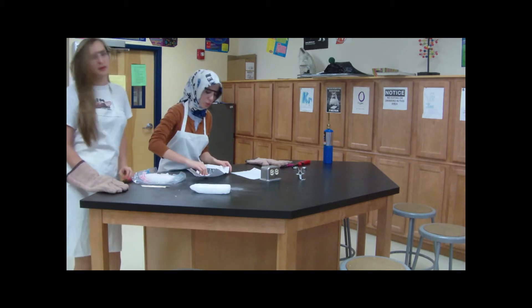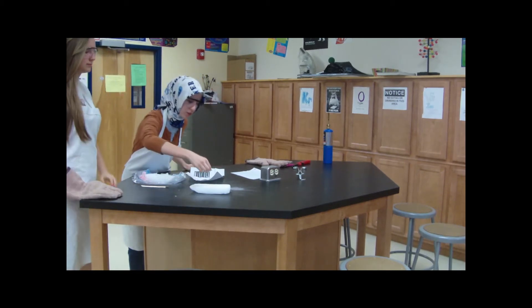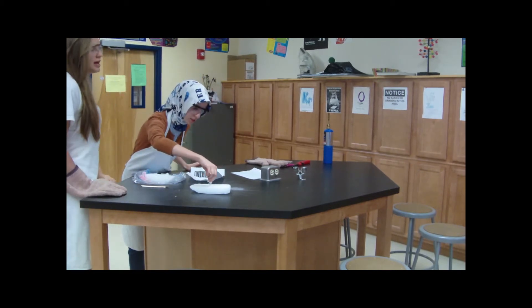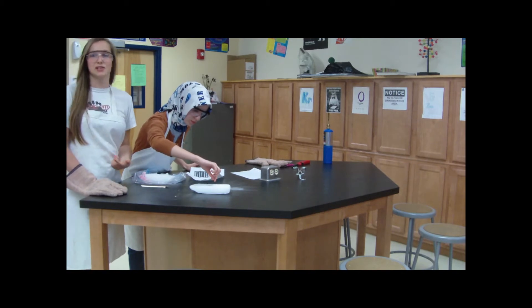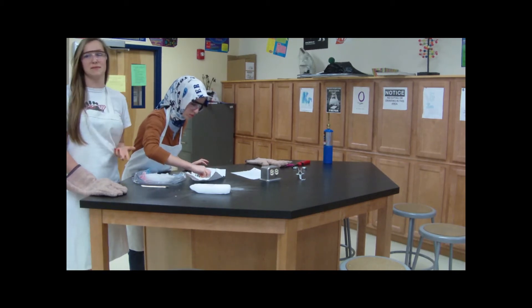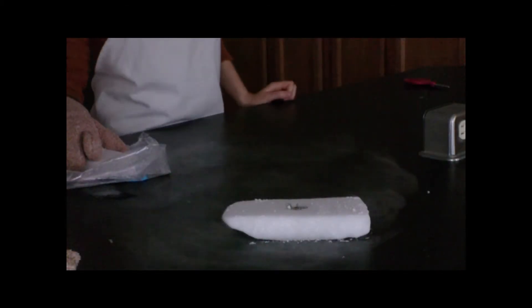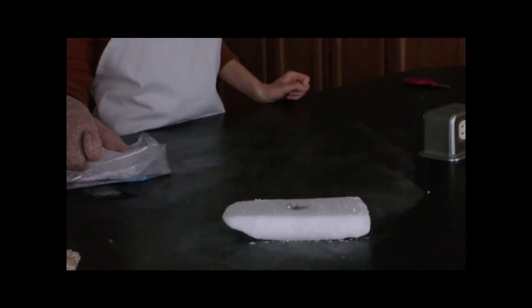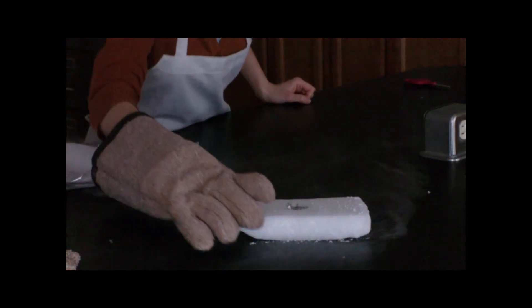First, you put the magnesium strips in the carved area of the dry ice. You don't want to put too much magnesium because then you can risk getting hurt because of all the sparks that fly. Now that we have that done, we're going to burn the magnesium, and the dry ice comes with the other ice block on top of it.